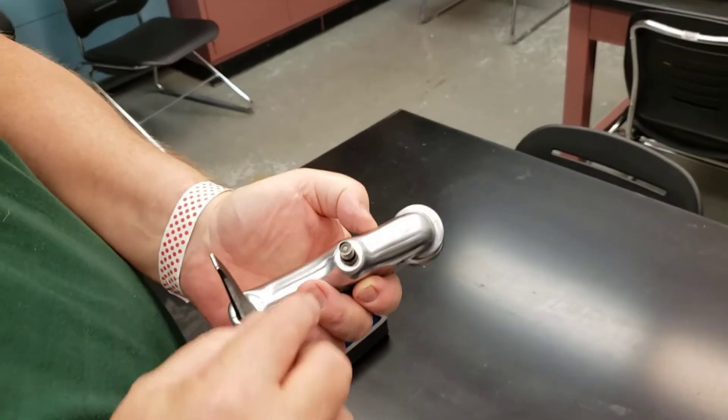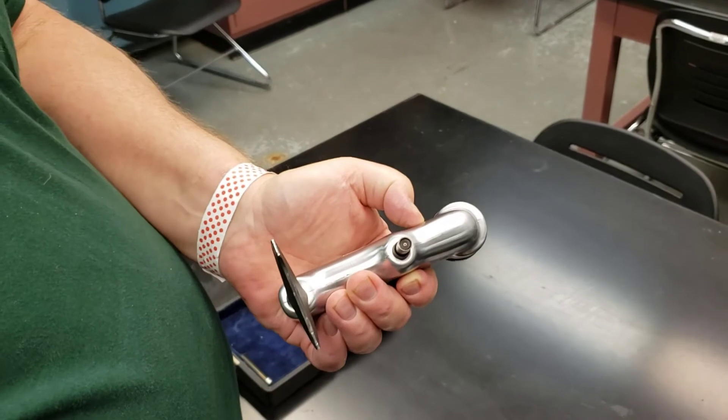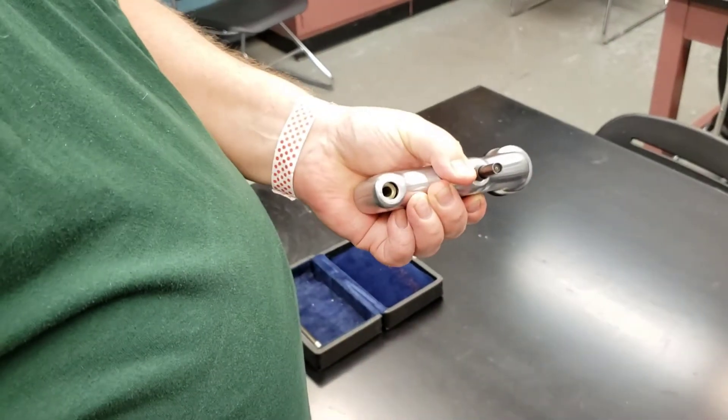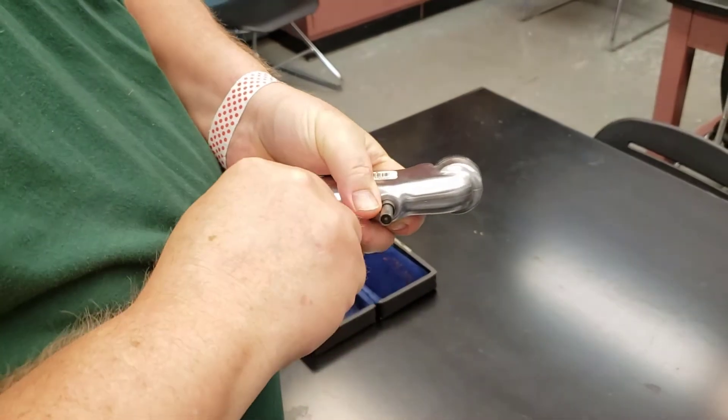This is a portable one. It has a needle here that I'm not going to stick my finger in because it's sharp and then a mounting stand that comes out so you can make it a little easier to carry this.